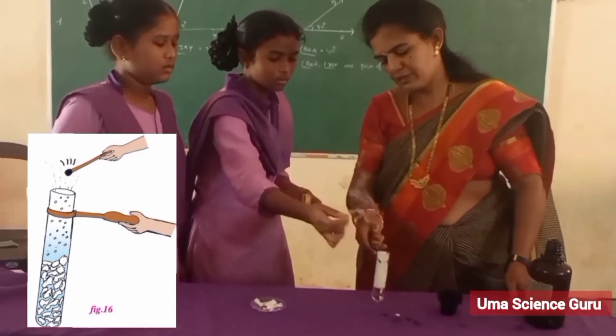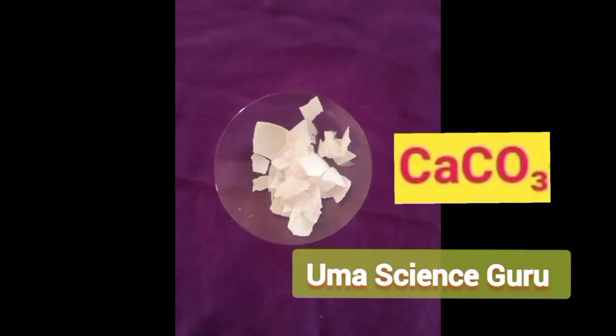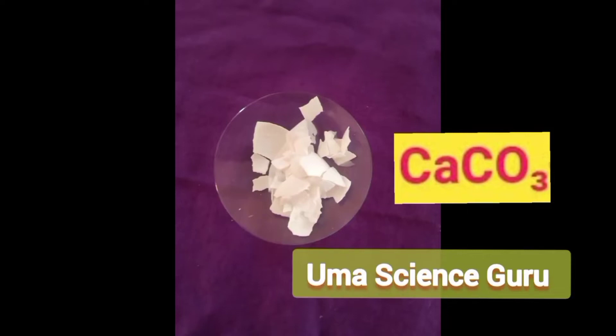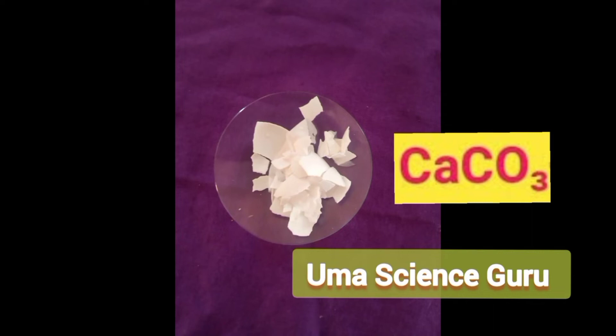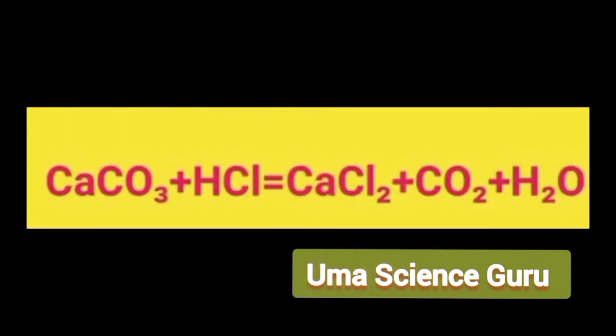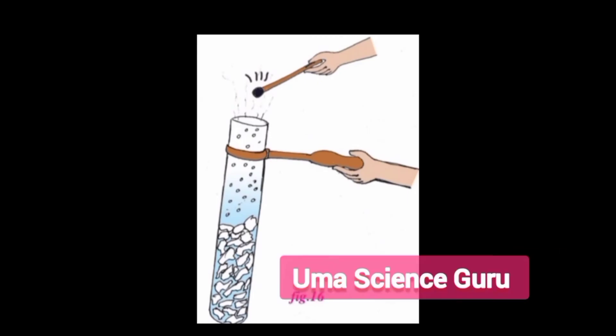From this experiment we conclude that an eggshell is made up of calcium carbonate. When HCl reacts with crushed eggshells — that is, calcium carbonate — it leads to the production of carbon dioxide. This carbon dioxide gas is a fire extinguisher and puts out the burning matchstick.